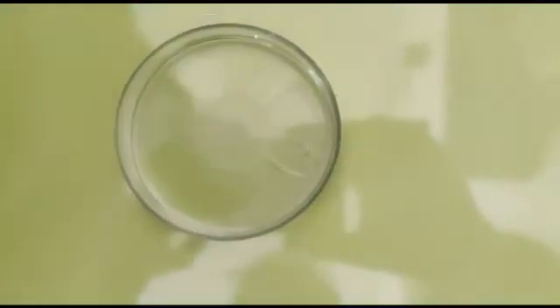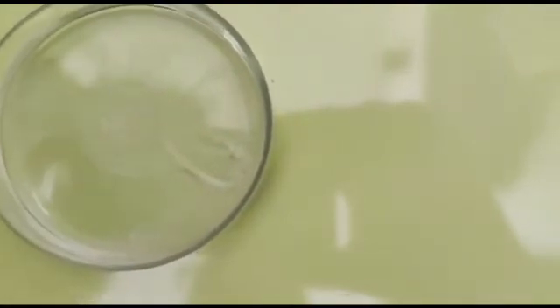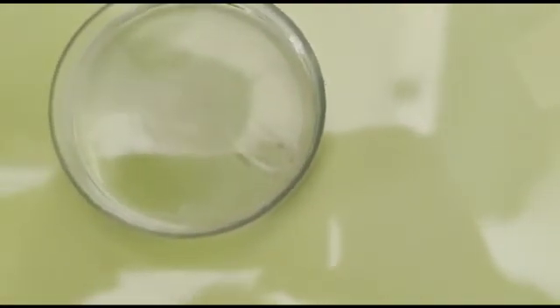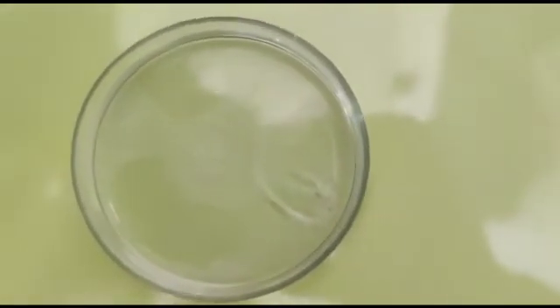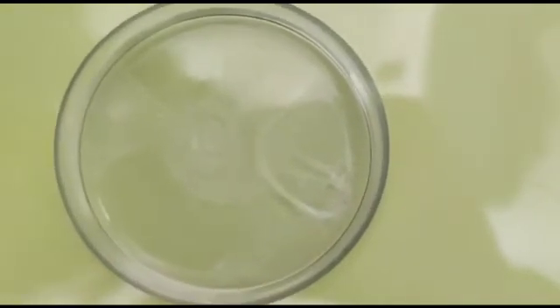Now we have to wait. After some time, white precipitates of DNA will appear here. You can see the appearance of white precipitates. I am zooming this. You can see as time passes, these precipitates will become more dense.